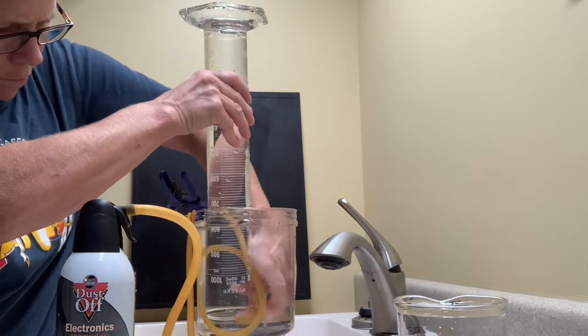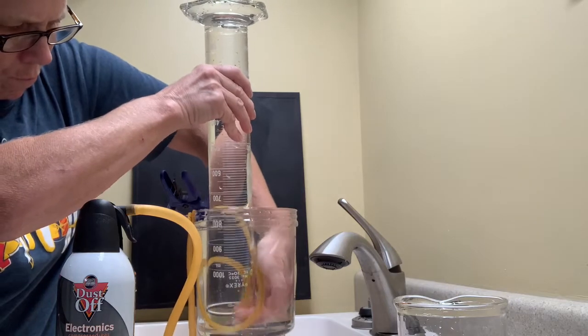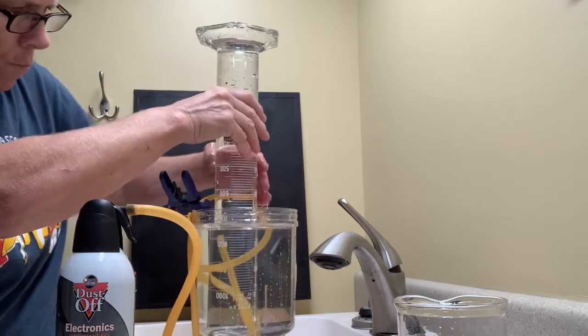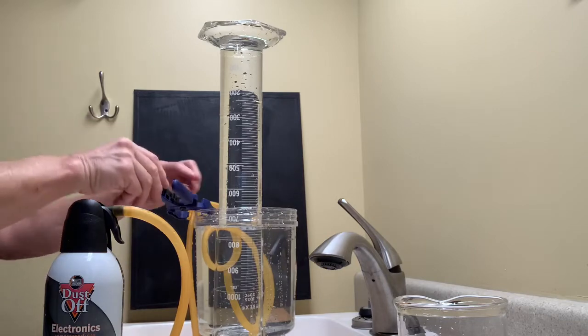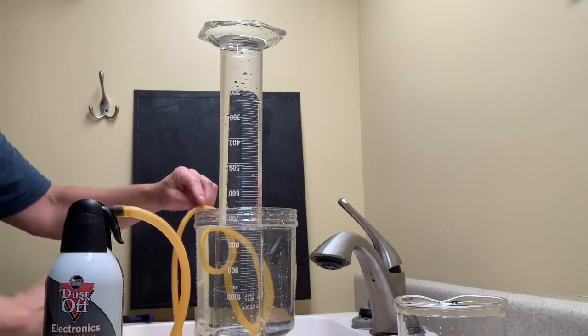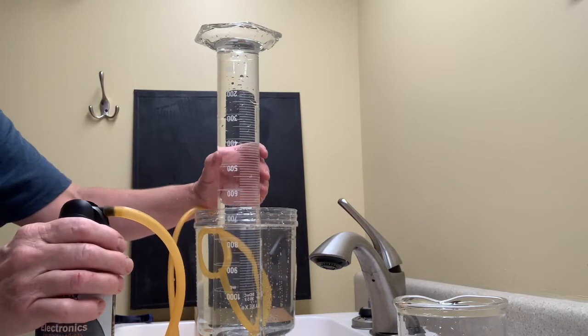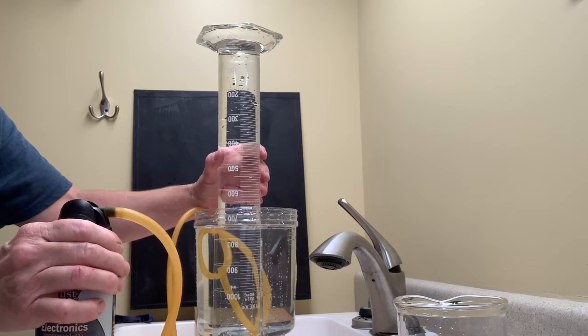Maybe another bubble or two introduced. I can see one at the top of the grad cylinder. Maybe a mil or two. And ready to introduce the gas into the cylinder.